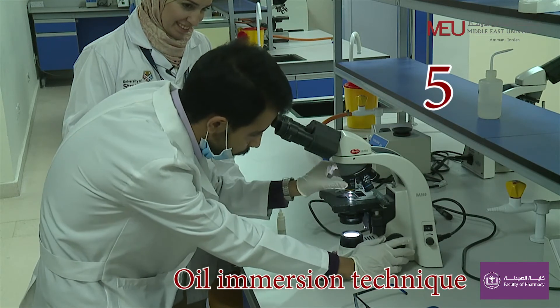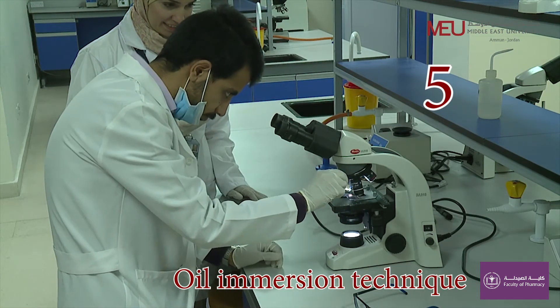Examine your smear under the microscope. Observe and document the color and morphology of the bacteria.